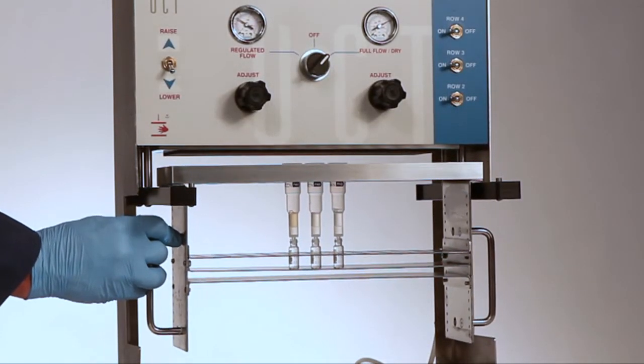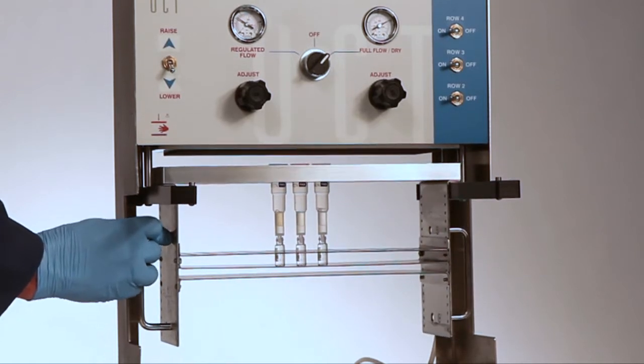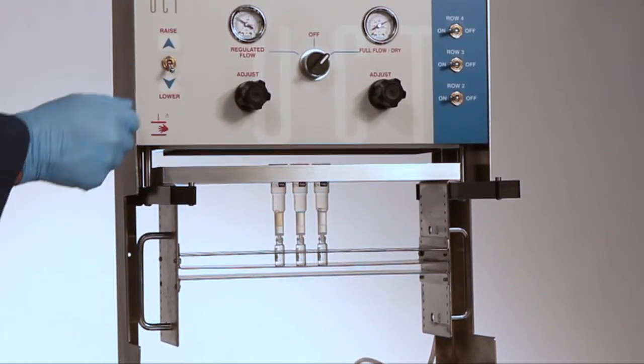Samples are loaded onto the positive pressure manifold. It's put into position and then it's raised.